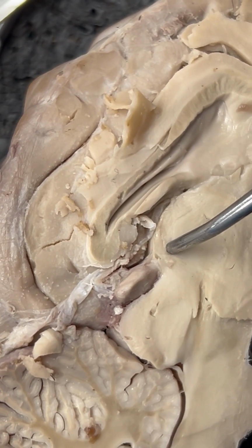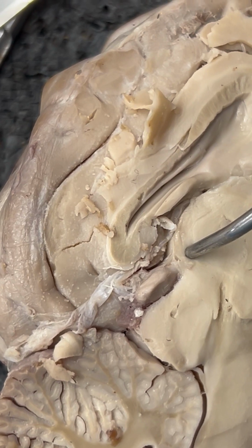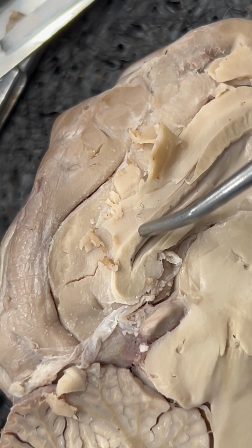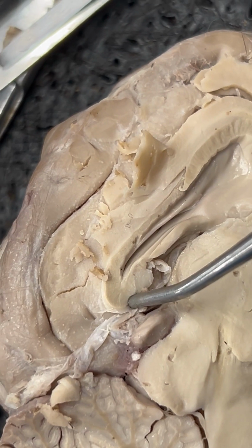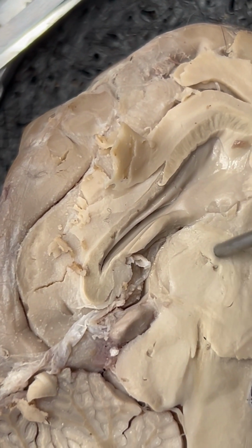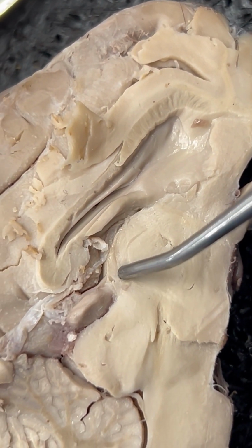It's cranial and ventral to the pineal body. Number 10, we have our corpus callosum, which is this line going along after we had our splenium. This becomes our corpus callosum. Number 11, we have the massa intermedia, which is a rounded segment, and we know that above that would be our habenular trigone.